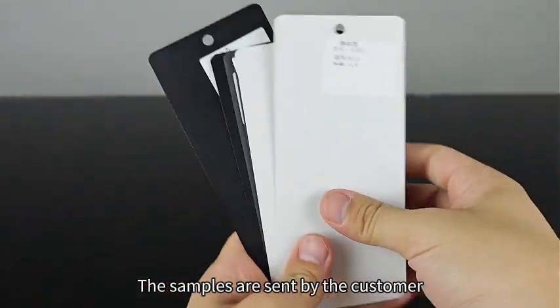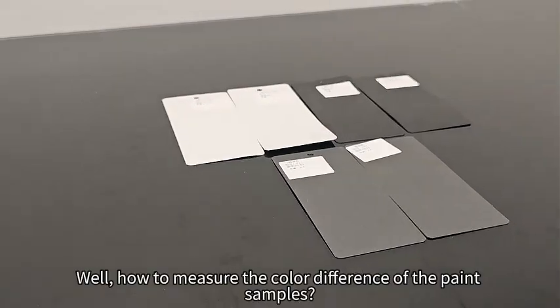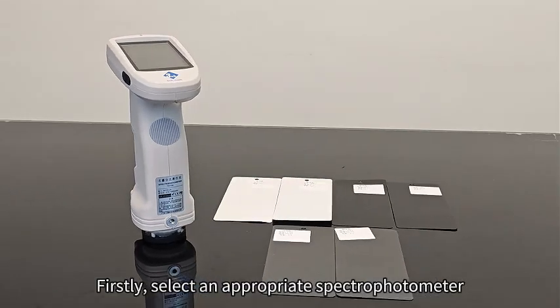The samples are sent by the customer, and they hope we can test whether the color difference meets the standard. Well, how do we measure the color difference of the paint samples? Firstly, select an appropriate spectrophotometer.